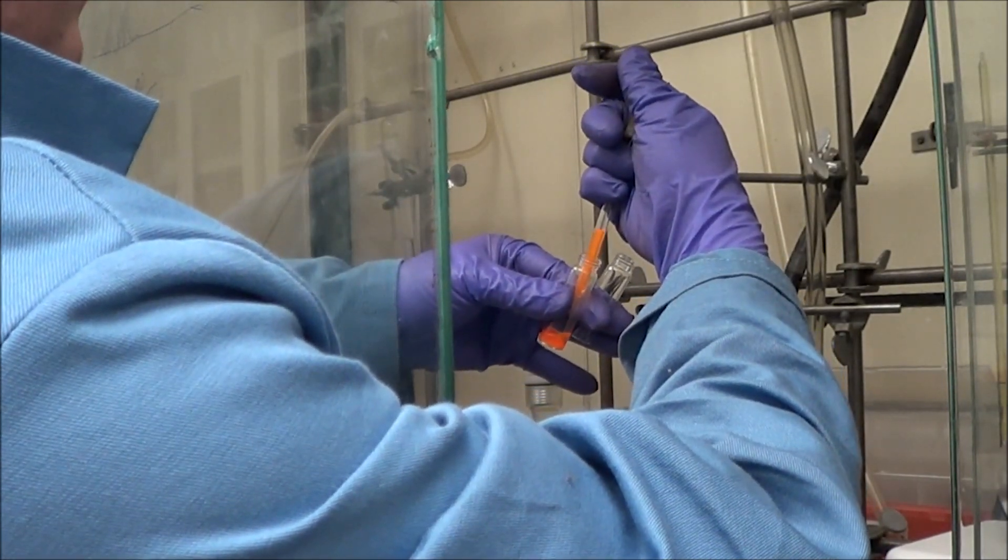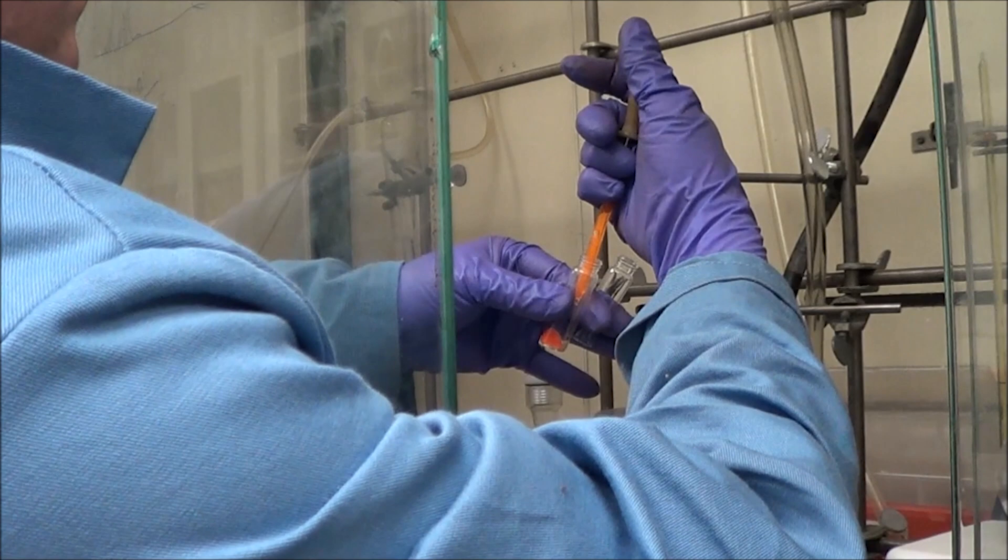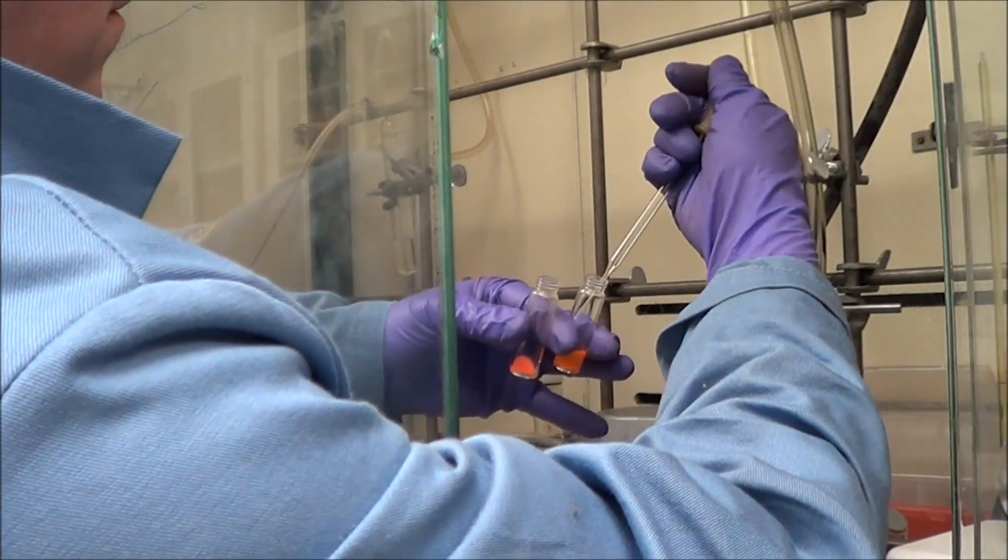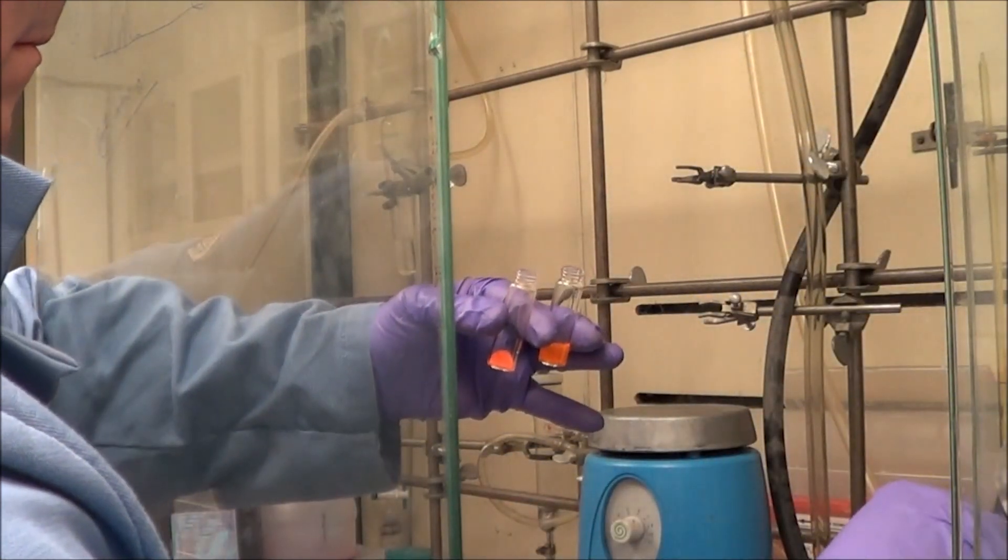What I do is I decant that into another vial very carefully. I do not allow any of the paste to transfer into the second vial. I've also pre-weighed that second vial, by the way.